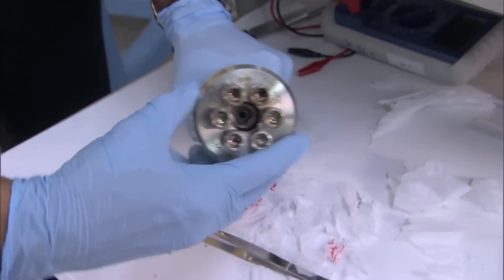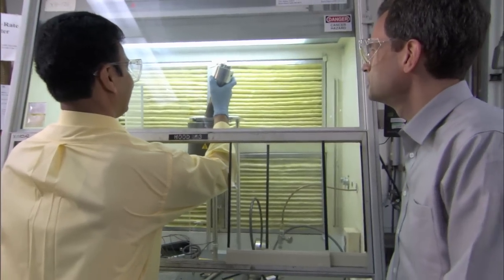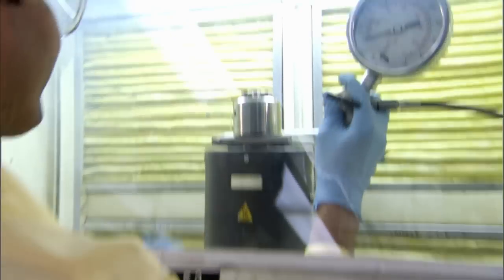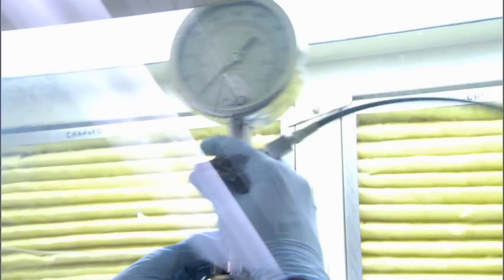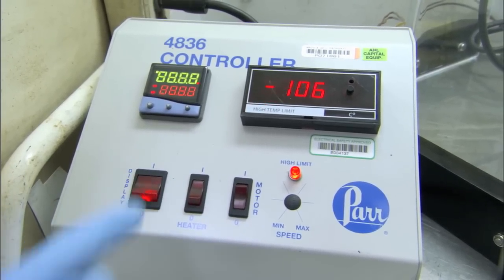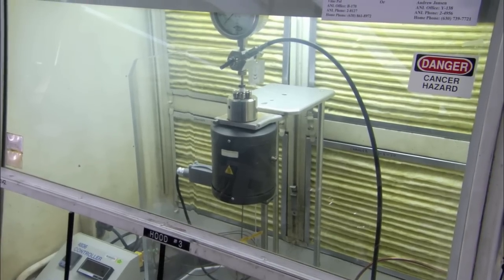Set the temperature to 1400 degrees Fahrenheit. Insert the reactor. Throw the switch. And cook for three hours.